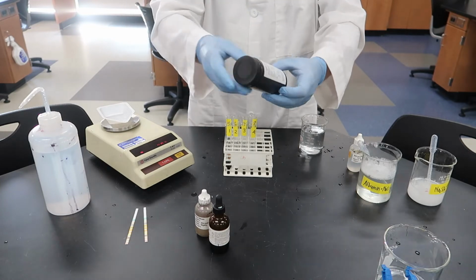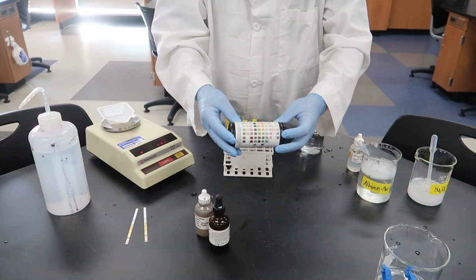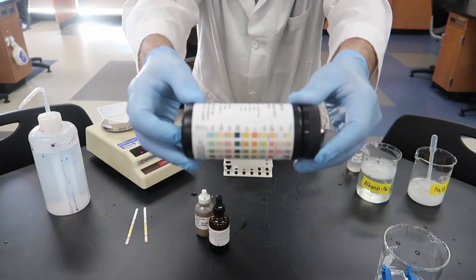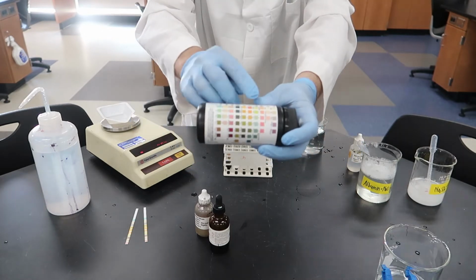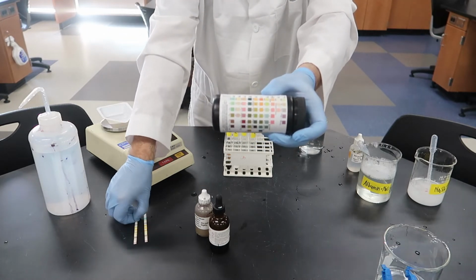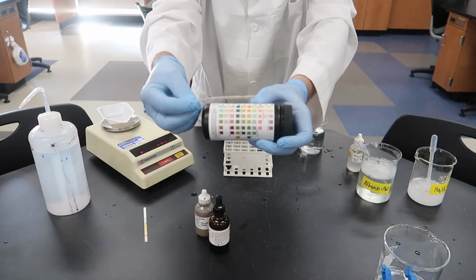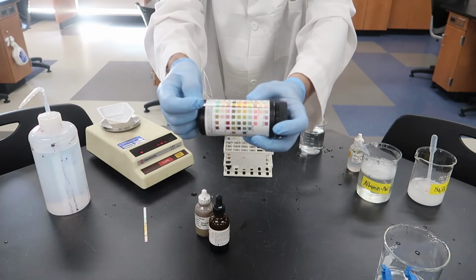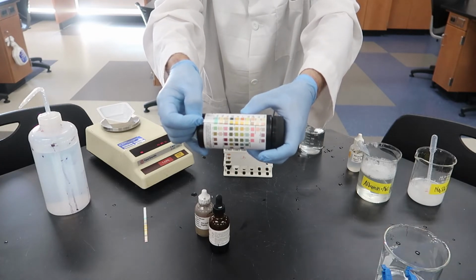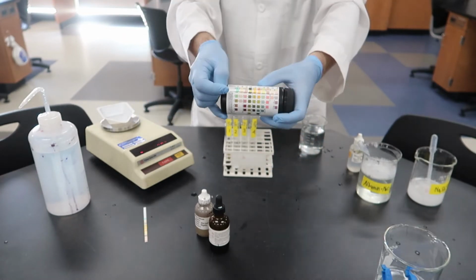Okay, I've got my 2 test strips set out, and this is the key to what those test strips will test for. I apologize that it's blurry. The print is very small, it's hard to see. But we're going to be looking at just one of those squares on the test strip and comparing it to the colors that are on the bottle. The way that you do this, you hold the handle of the test strip down at the bottom of the bottle. You line up the squares, and then you can see there that they match color.